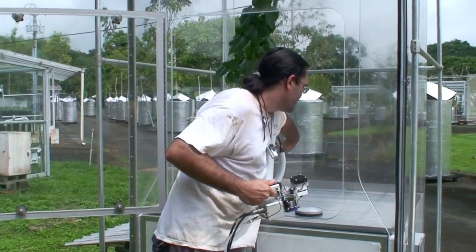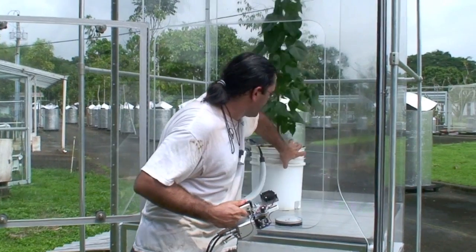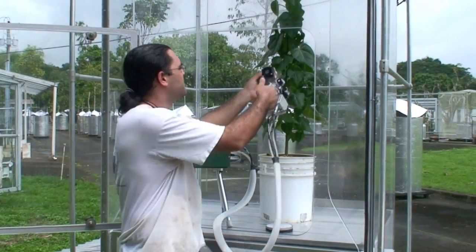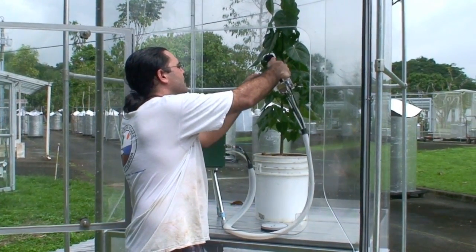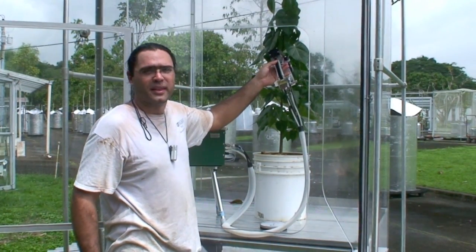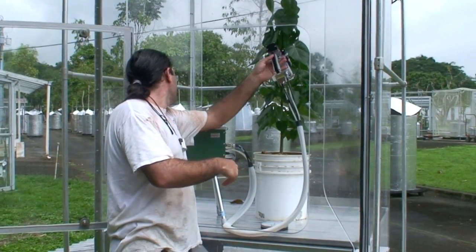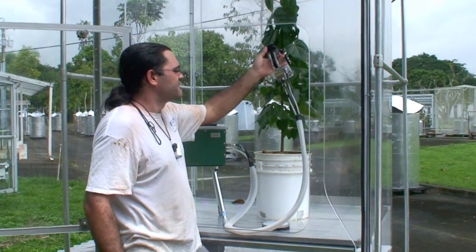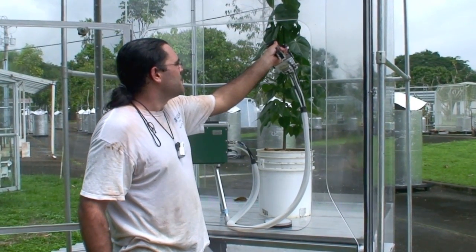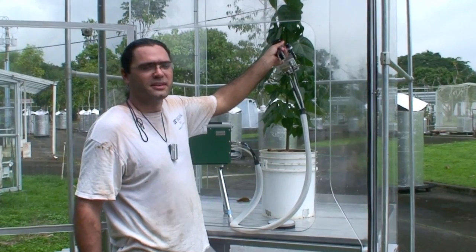What we can do in a situation like this is take our plant, clamp onto a leaf, and then monitor the photosynthetic rate of that leaf. This plant is actually quite happy and photosynthesizing very well, but what it enables us to do is monitor leaf-level changes as a result of temperature.